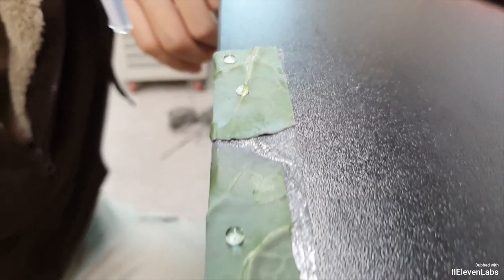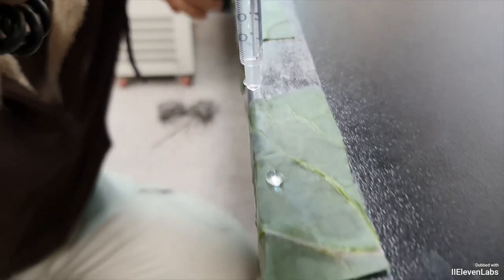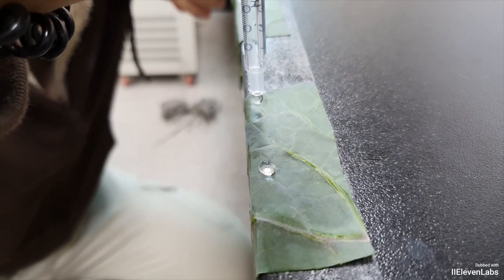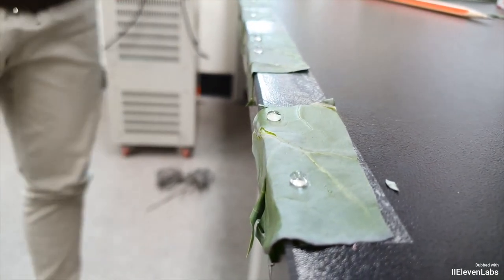Since the amount of surface wax on plant surfaces can vary depending on the cultivation environment and the age of the collected leaves, performing three or more biological replicates will help you achieve more reliable experimental results.